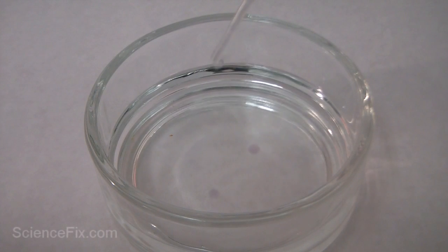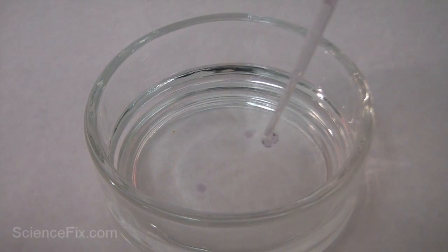Drops of sodium alginate are dropped into the calcium chloride solution, and a chemical reaction instantly happens.